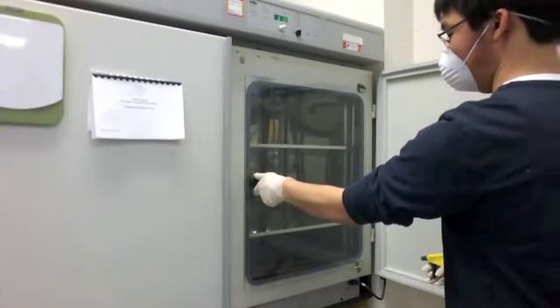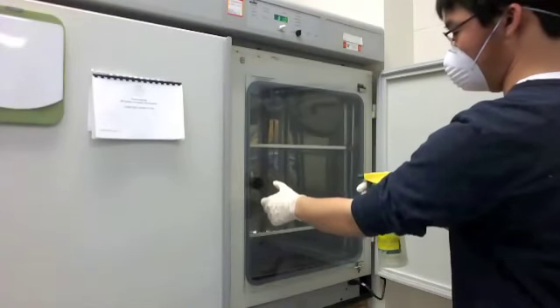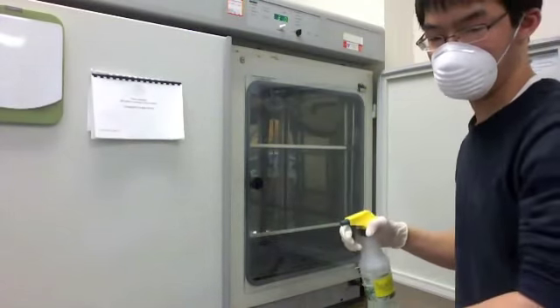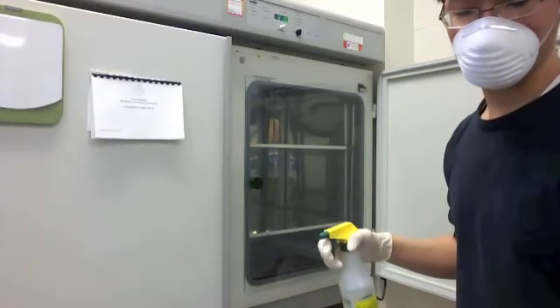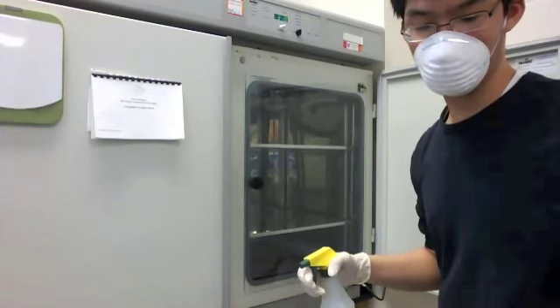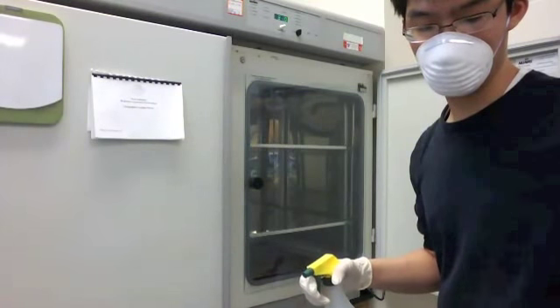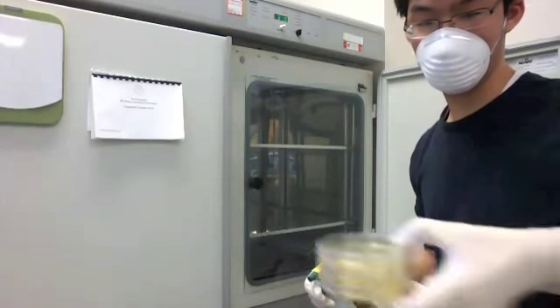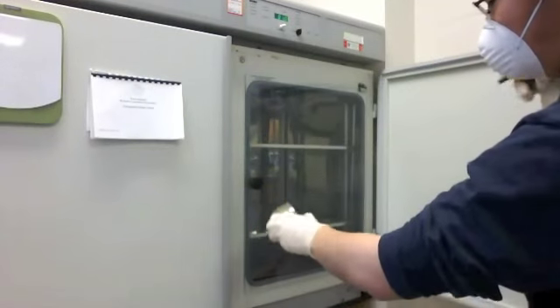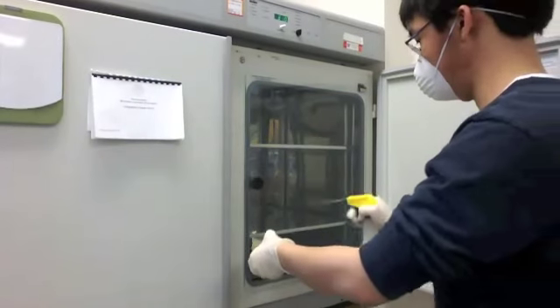I'm opening the door now — turning the knob ever so slightly — and then spraying the petri dishes again before they go in, because there's a chance that the table I put them down on has a little bit of bacteria. I'm taking those plates up from the table and spraying them from every angle with ethyl alcohol to make sure any bacteria on the outside does not get transferred into the plates themselves.